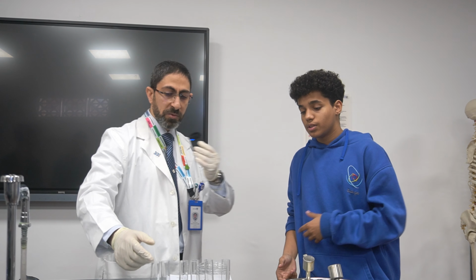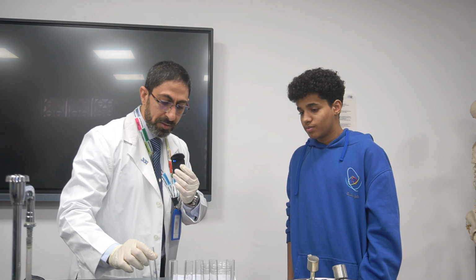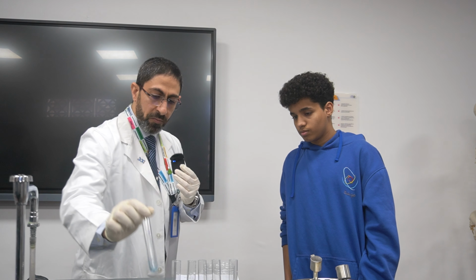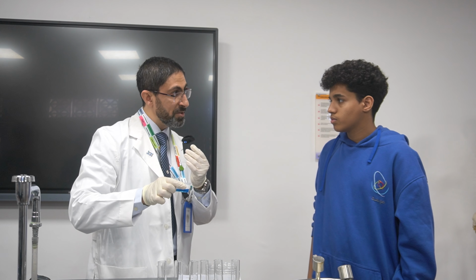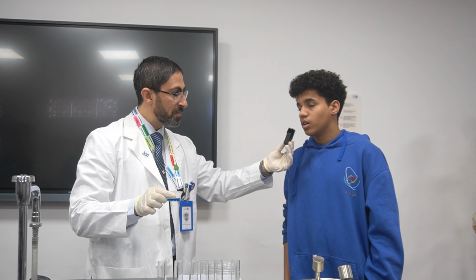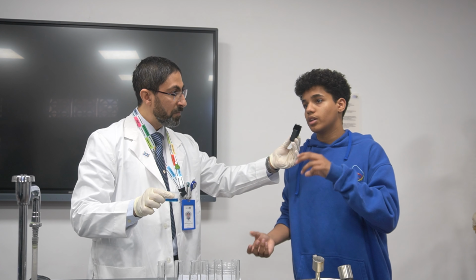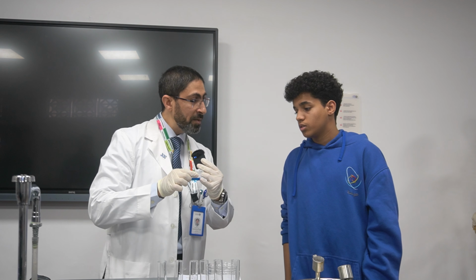As you can see, when we have a concentrated solution, which is the last one in this case, outside there is a hypertonic solution. Hypertonic solution means low water potential with high solute. Exactly. So more solute and less water.